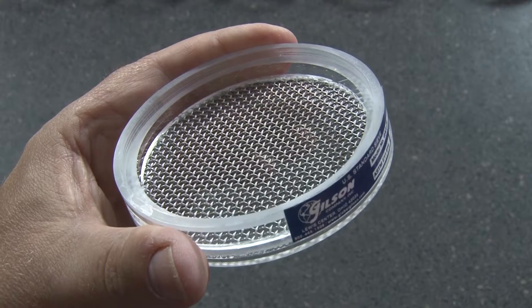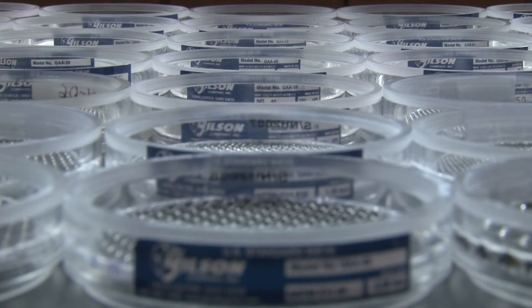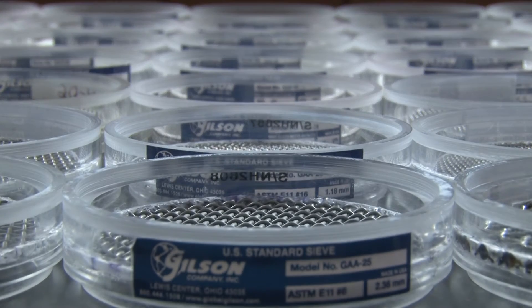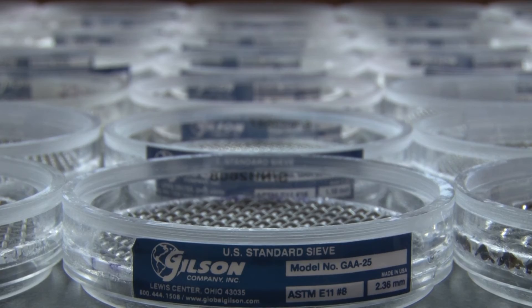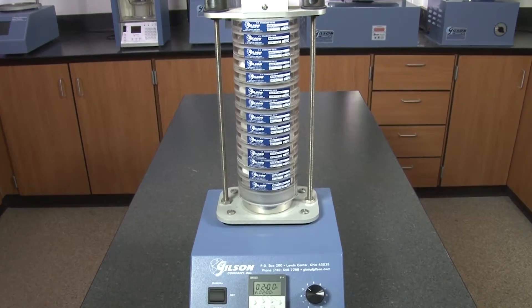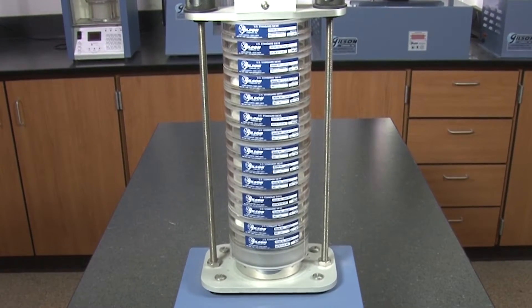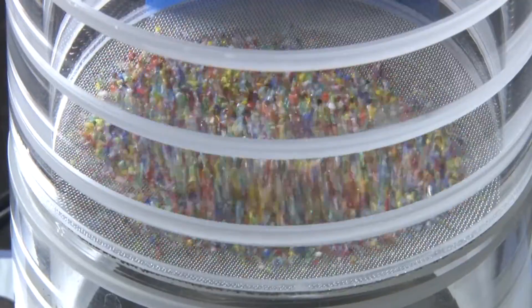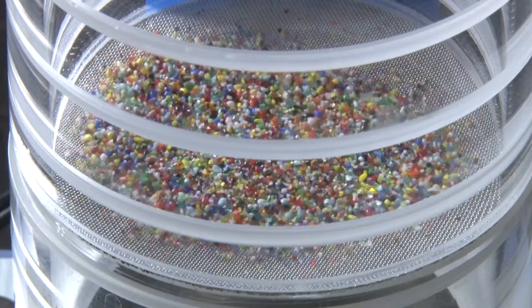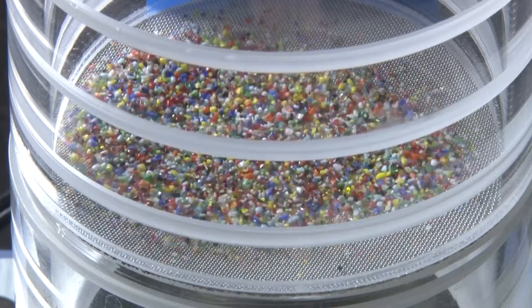And finally, acrylic frame sieves. Acrylic frames have certain advantages for smaller diameter sieves. The acrylic material is easily machined for a precise nesting fit and allows for visual monitoring of the sample during the agitation process.